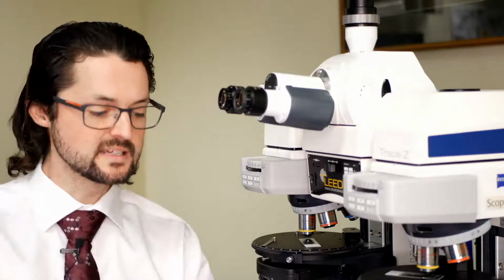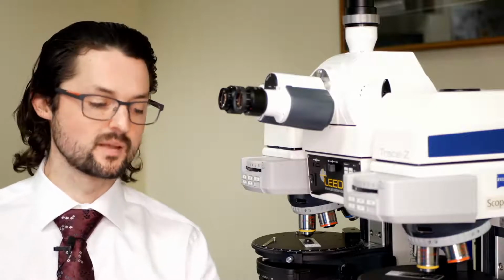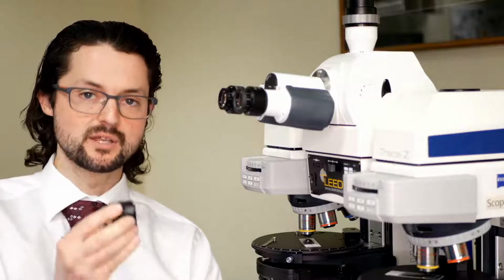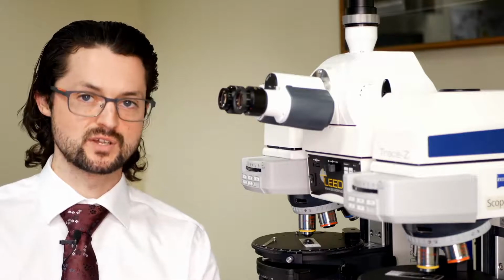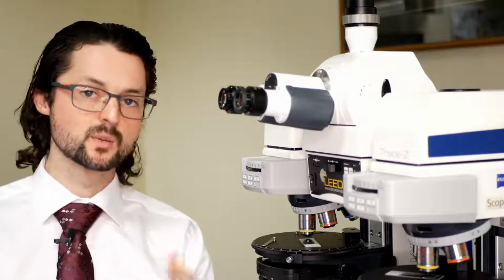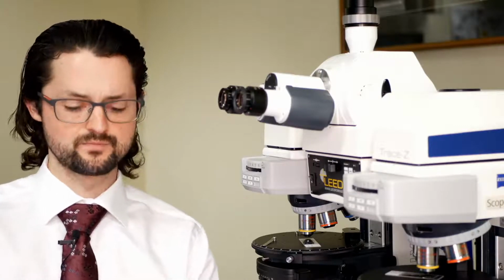So Leeds, what we do, there are some other things that we have to pay attention to. And why is this important? The reason is that we can either come to your existing comparison scope, maybe an older fluorescence trace comparison microscope, or maybe you're interested in buying a completely new comparison microscope. It's a lot easier upgrade path.